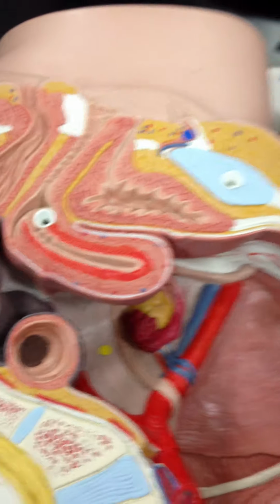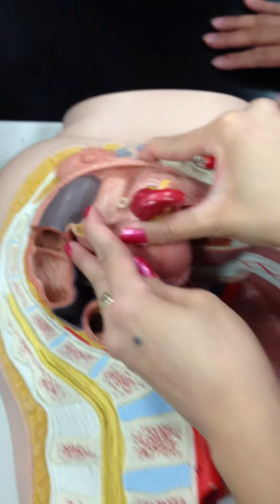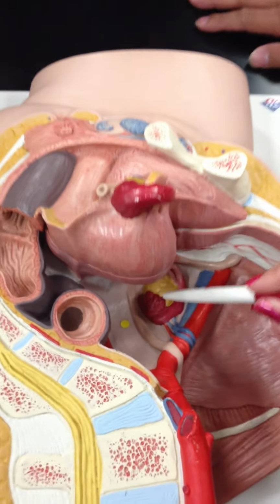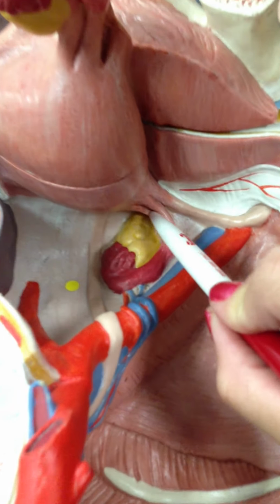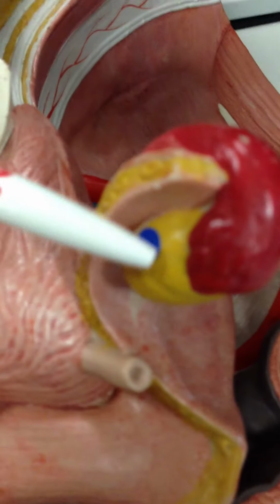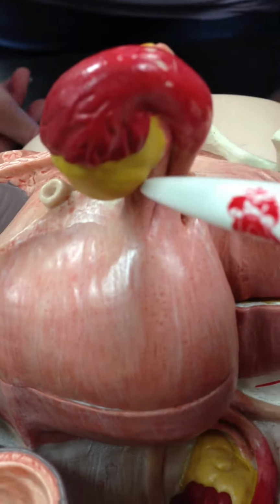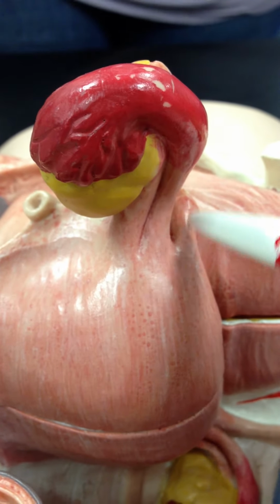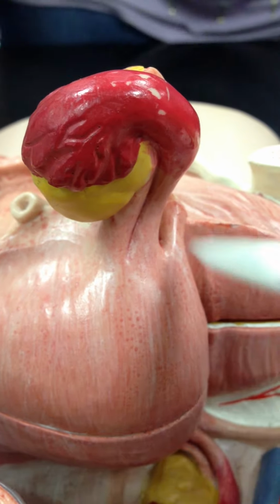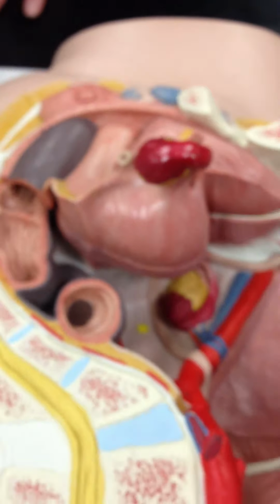Ovarian ligament, I can show you on here also. Ovarian ligament attaches the ovary to the uterus, so the ovarian ligament would be right there. And on this side, you can also see it. Here's the ovary. So then the ovarian ligament, you can see it on this side. It's just right there, attaching the ovary to the uterus. Don't confuse it with the uterine tube. Yeah. It's bigger. Okay. I think that's it.